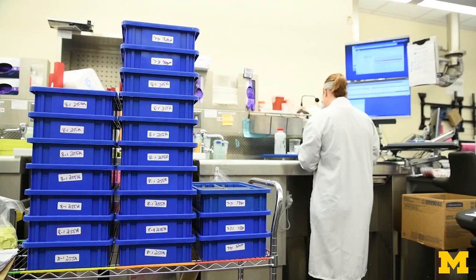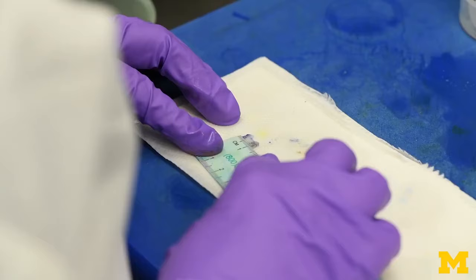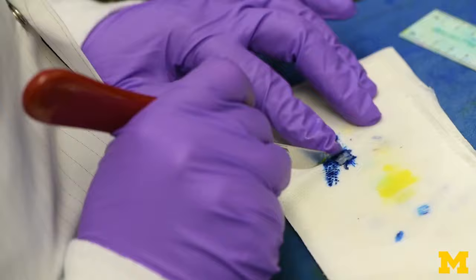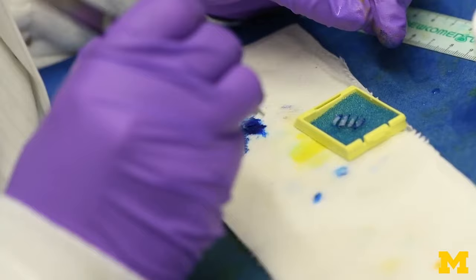When the biopsy arrives in the surgical pathology laboratory, it, along with many others, is examined, measured, and described during a process known as gross evaluation. Larger tissues are marked with red, yellow, or blue dyes, and then dissected. After evaluation, the specimen is placed into a unique numbered and barcoded plastic box, known as a cassette.